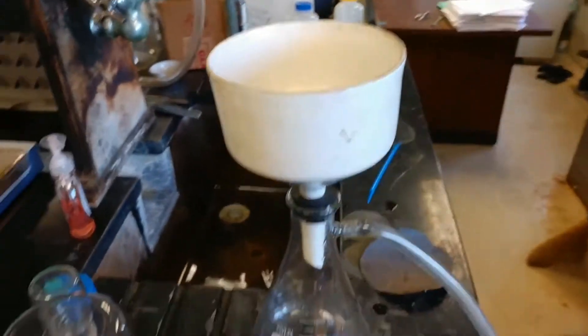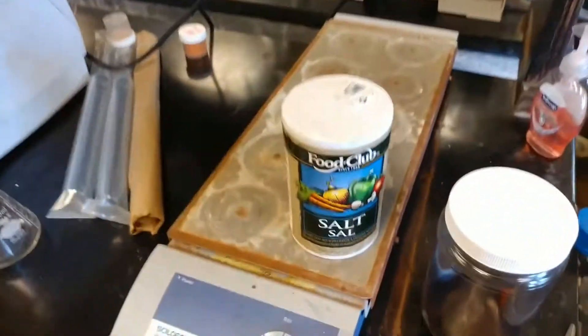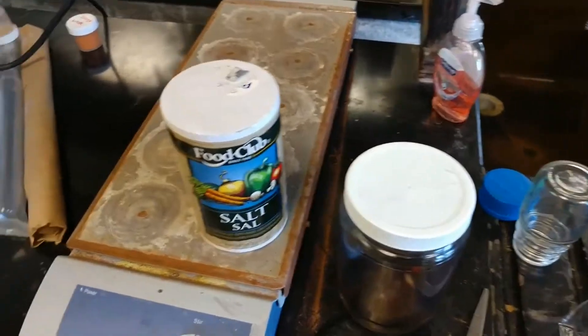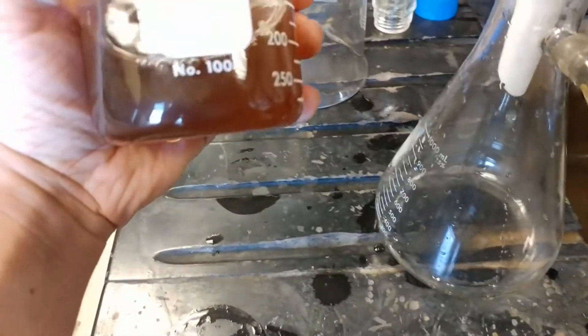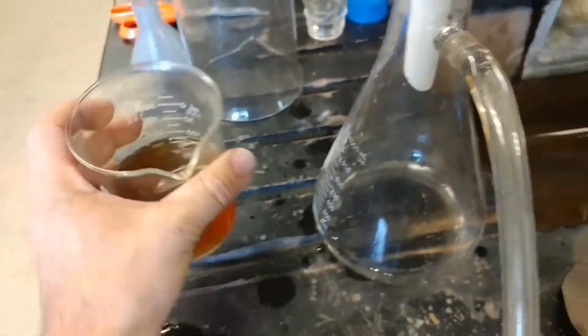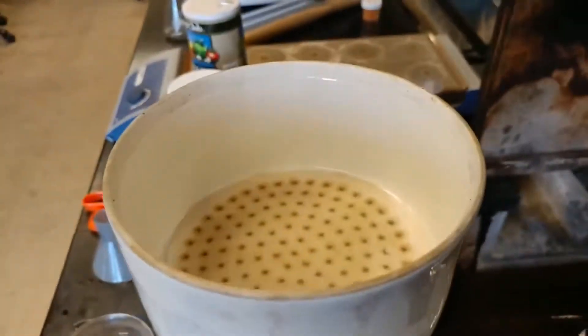Okay, I got it to work. So today's little experiment involves regular old salt, some water which we'll pour in here, and some GO (graphene oxide) that I made. This is suspended in liquid. And we've started making the filter already.